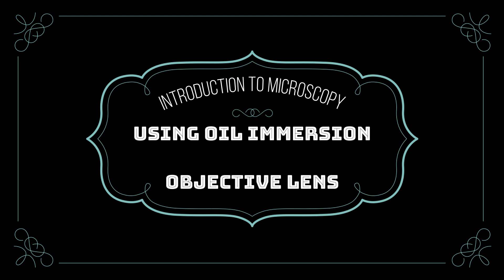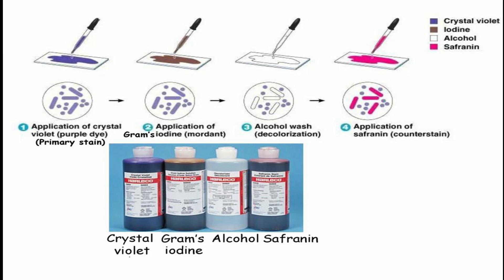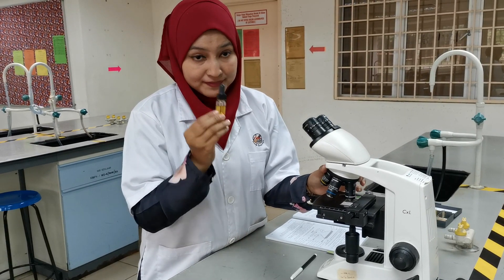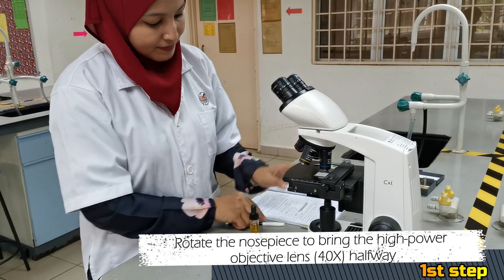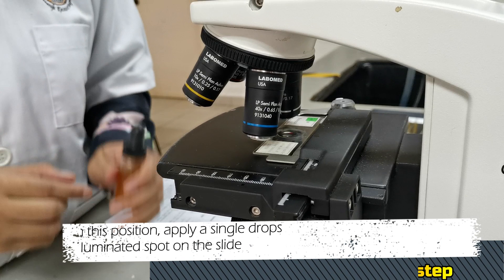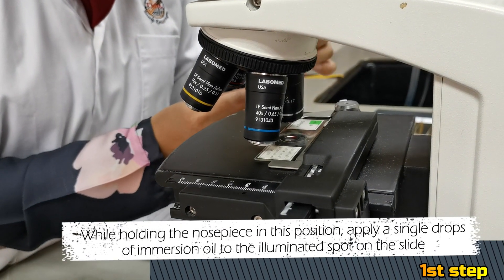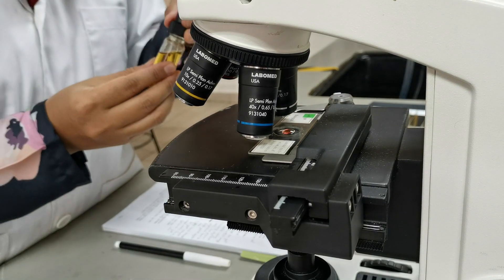While using the microscope, you will be using the oil immersion objective lens to observe microorganisms such as bacteria and protozoa, or to observe microorganelles. Before using the objective lens, the specimen has to be fixed and stained to increase its contrast. We also require immersion oil to aid observation. First, rotate the nosepiece to bring the high power objective lens, which is the 40x objective lens, halfway. While holding the nosepiece in this position, apply a single drop of immersion oil to the illuminated spot on the slide.